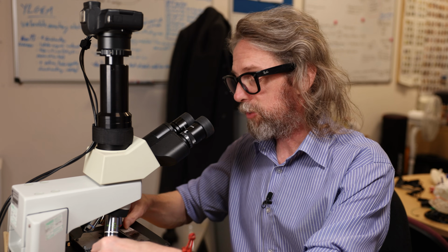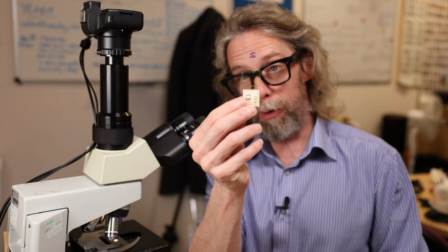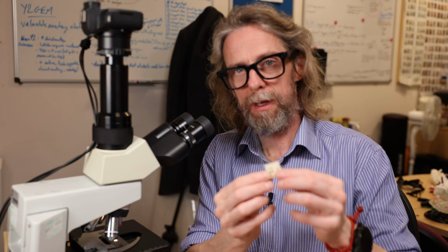So, the tongue. Because we've got all those muscle fibres running in different directions, we get to see muscle fibres in a longitudinal section, and we get to see muscle fibres cut in a transverse section. Now, the other slide I've got is black. So I assume this is a silver stain, and this will let us see the striations even better.